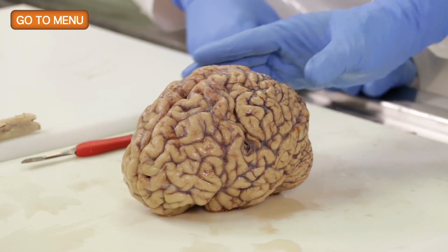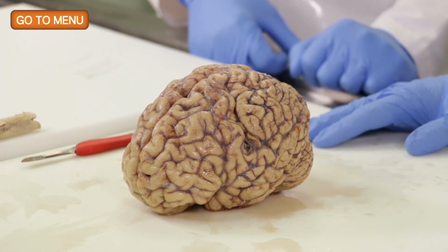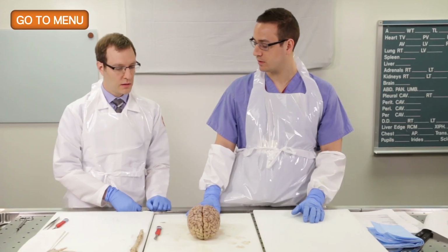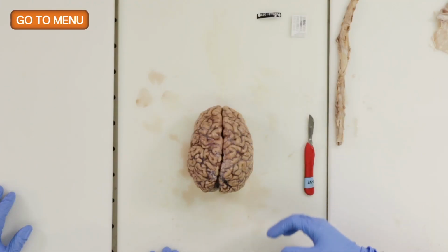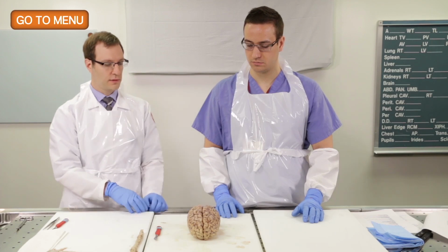In this case, I think the meninges are clear and pretty unremarkable. That's right. Yeah, exactly. So you want to look at the leptomeninges. It's a thin membrane covering the brain, but when it is involved by inflammation or infection, you will see opacification. So you want to make note of that. Okay, what else would we look for?